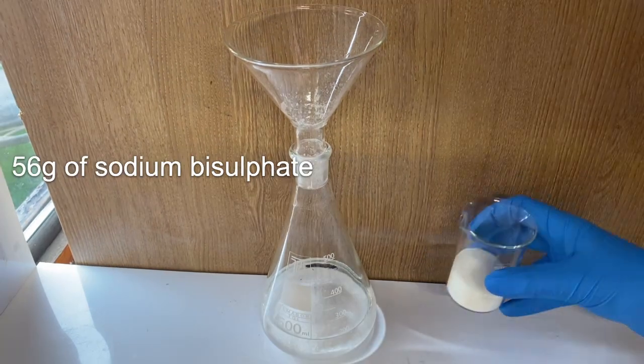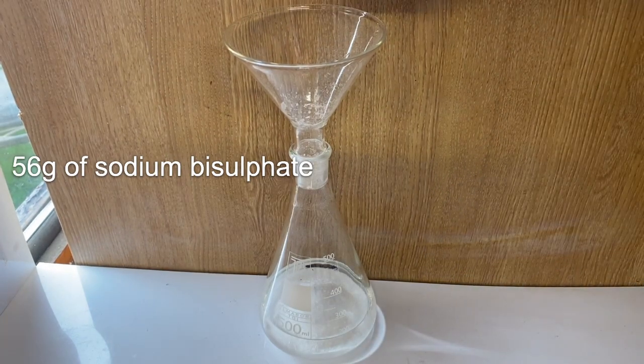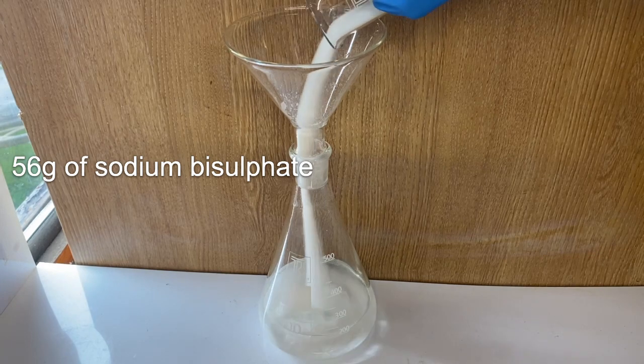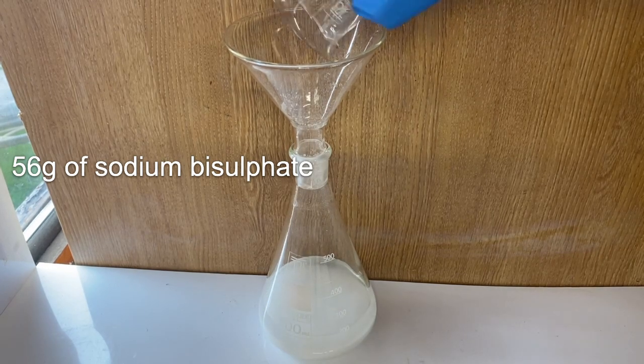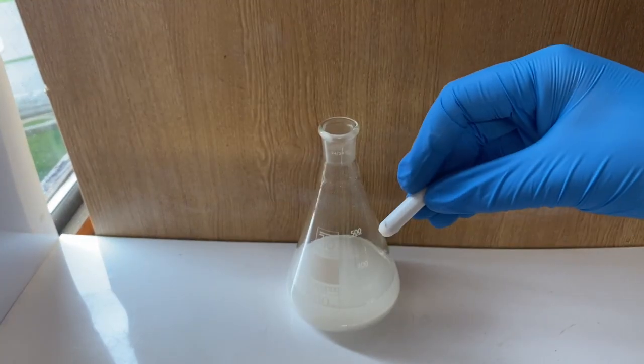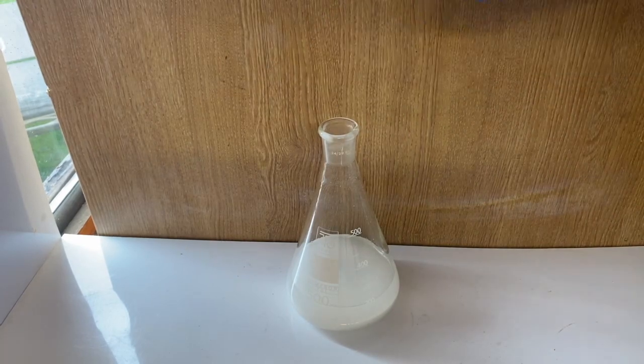The third thing that I needed was sodium bisulfate. Sulfuric acid could also be used but I can't get that without a license, so I'm using sodium bisulfate instead.